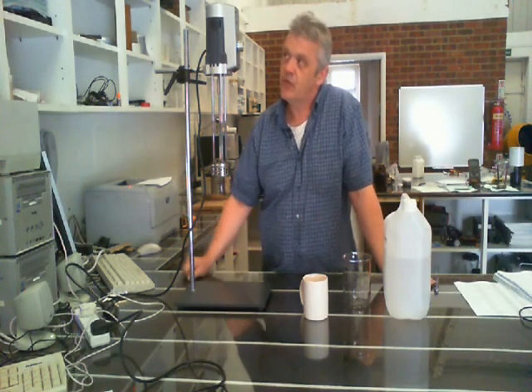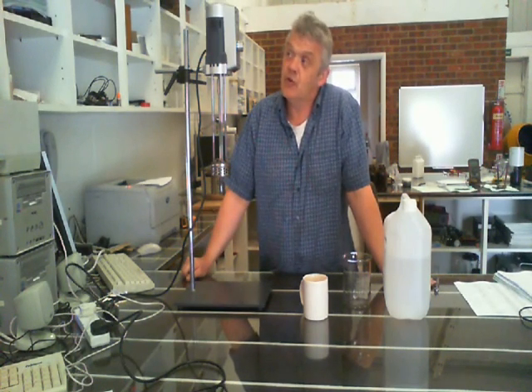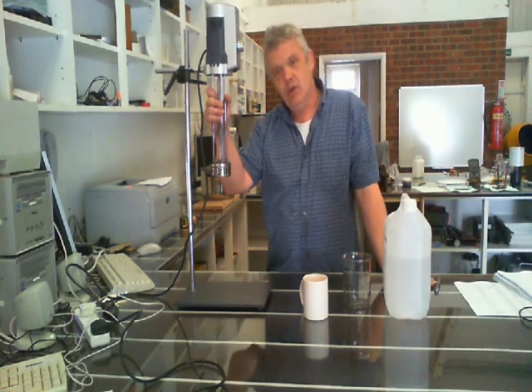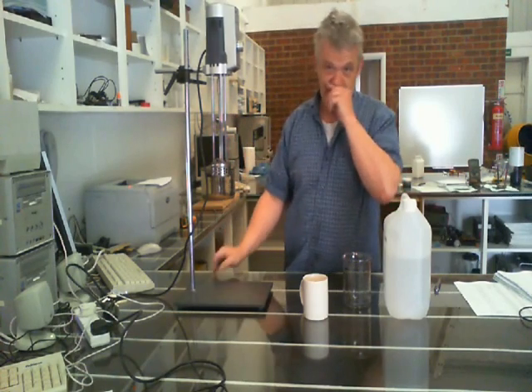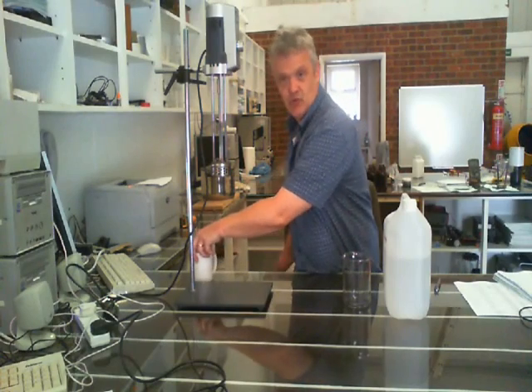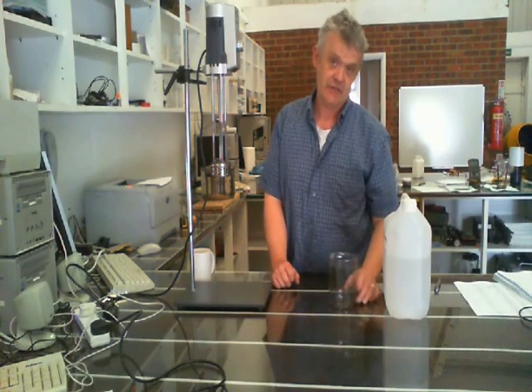This thing actually spins up to 13,000 RPM and will last for hours. It has interchangeable heads so you can do different things with it, and it's very cool — I use it quite a lot. So we're using basically a blender method; I'm using the homogenizer, but it's a blender method, based on a sonication paper I was reading about graphene solvents. The graphene solvent has to have certain properties: something will dissolve as long as the attraction between the solvent and the material is at or slightly greater than the attraction that the plates of graphene have to each other. Finding that solvent has been a bit of a challenge.